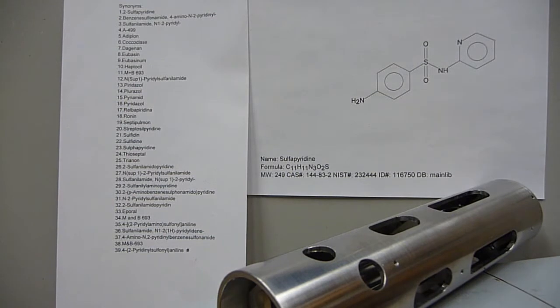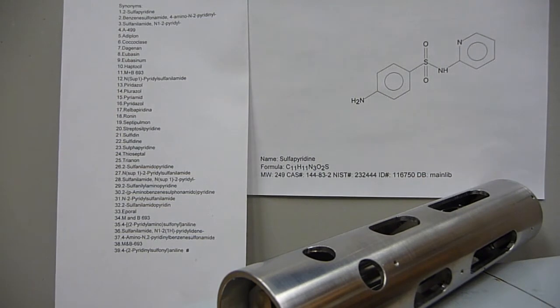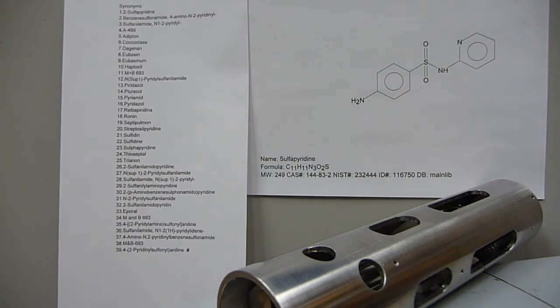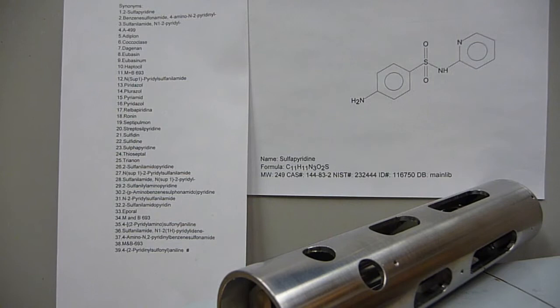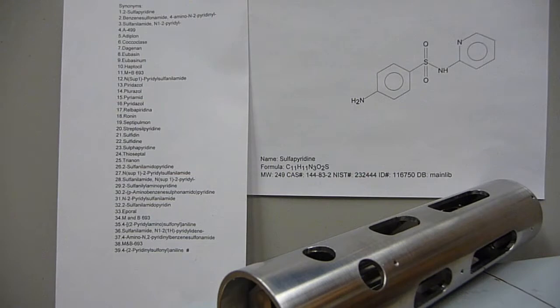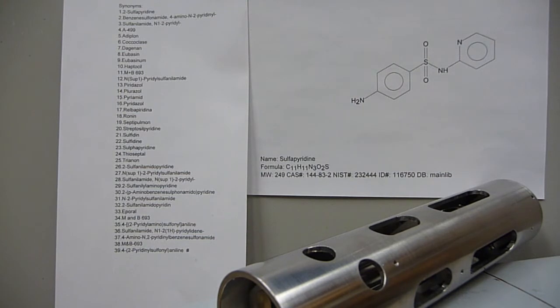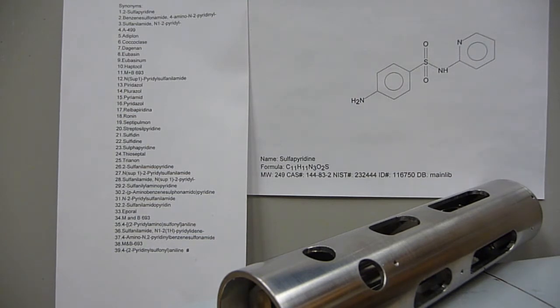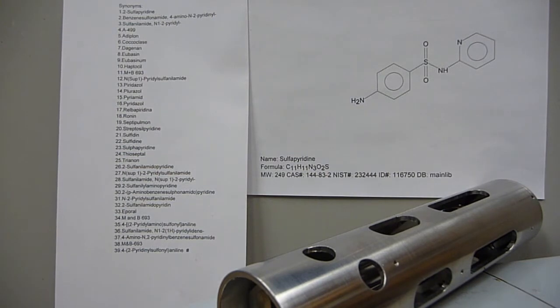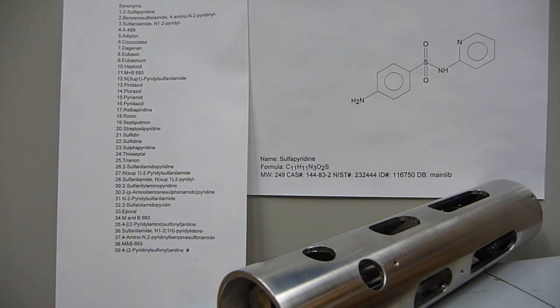Our compound is sulfapyridine, molecular weight 249, and from the NIST 2014 MS library it has over three dozen synonyms. The three ionization modes are going to be electron impact for GC mass spec, electrospray ionization for LC-MS and MS-MS, and helium metastable impact for DART. You're going to see that the spectra are definitely different, so let's get started with GC-MS.